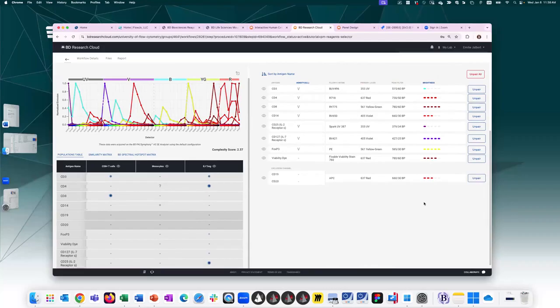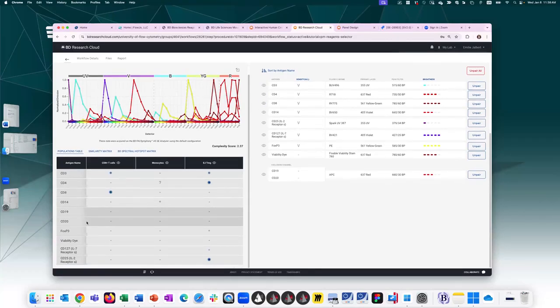So once I've assigned all the fluorochromes, now I have a better image of what a potential panel might look like. If I want to remove certain fluorochromes from the spectrum viewer, I just hide them from view or put them back into view. But because we spent all this time optimizing the populations table, what I can do is click on the eye icon here for this first population. For CD8 T cells, pressing the eye icon removes from view any of the markers that have been marked as negative. So in this case, CD8 T cells will only truly have these two fluorochromes assigned to this population. I can, in isolation, look at the fluorochrome profile of this population and see if there will be any co-expression issues. And in this case, no, this looks great.